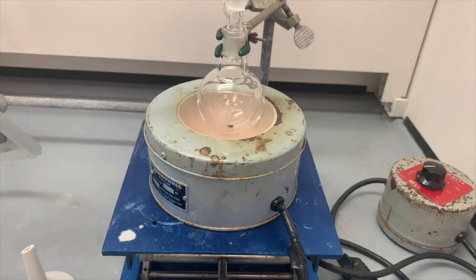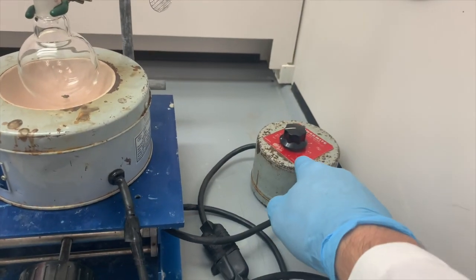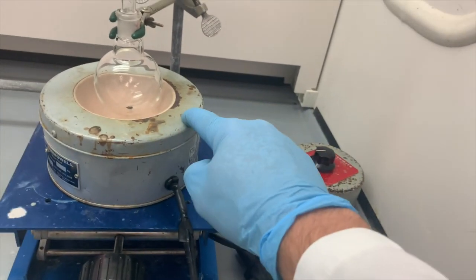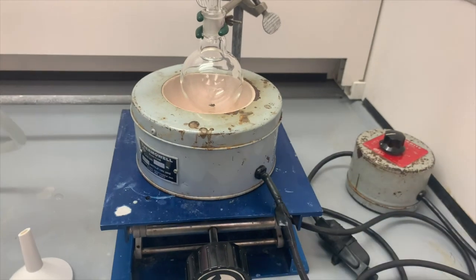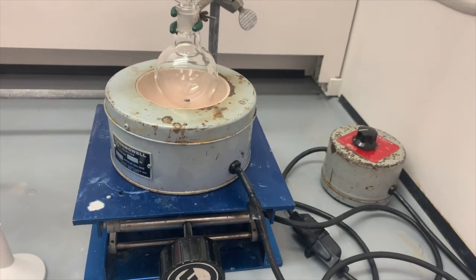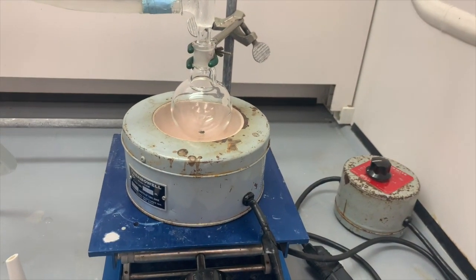The thermowell will be applying heat to the reaction, and then we have this attached inline variac that's going to control the amount of current that goes to the thermowell. If we directly plug the thermowell into a wall outlet, that's going to get extremely hot extremely quickly. So the variac controls the current, controls the amount of heat, and allows us to monitor the amount of heat that we're providing and control it.